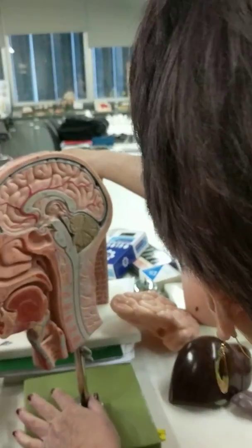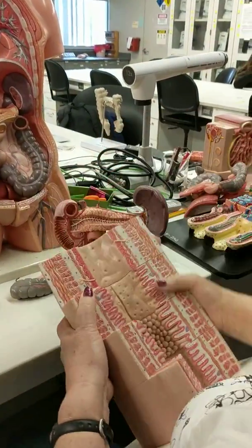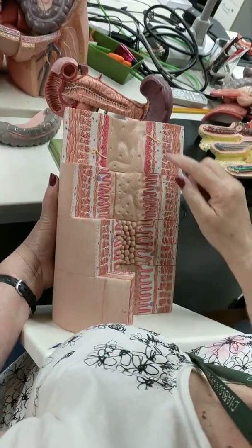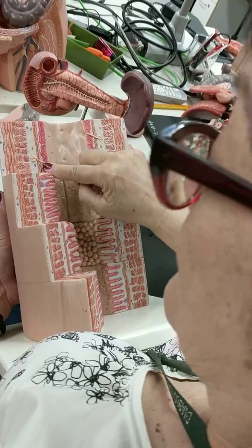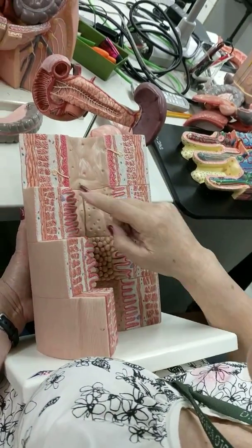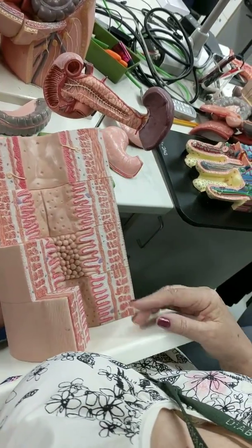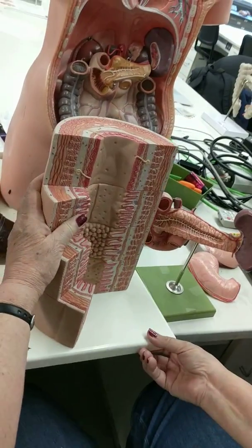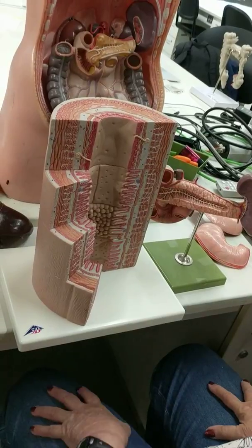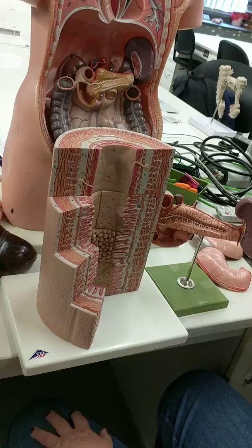If it's the first time through, you're going to be lost. Okay, this is sort of a faulty thing, but showing the digestive tract, okay? I would say this is stratified squamous, so that should be the esophagus. And there's glands here. This would be the stomach. This would be the small intestine with villi, and the colon, the large intestine part, colon is part of the large intestine. It doesn't have circular folds, it doesn't have villi, although one book I saw said it did have villi. But it was supposedly not villi, but it has microvilli.